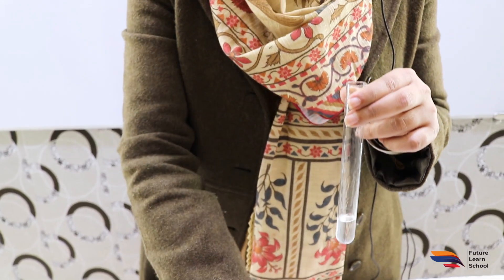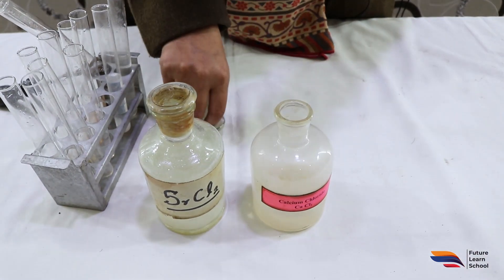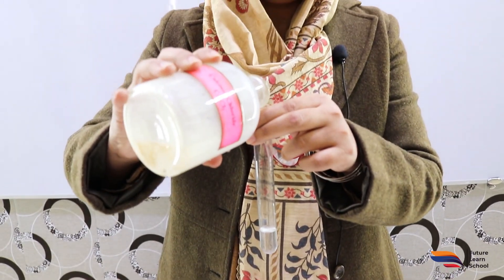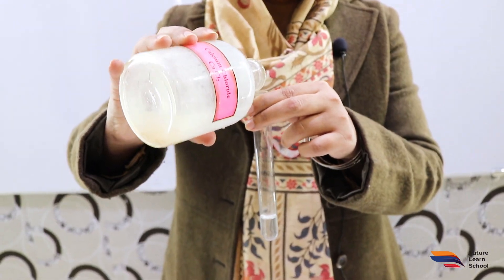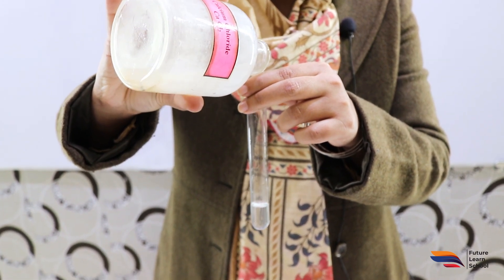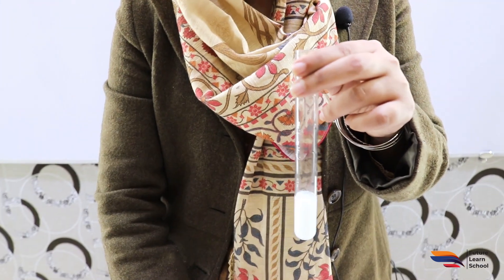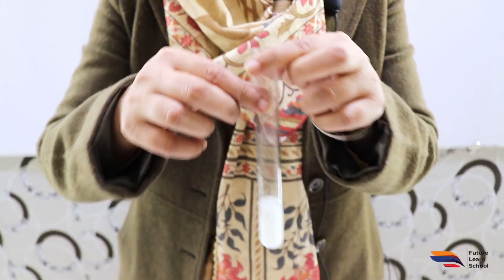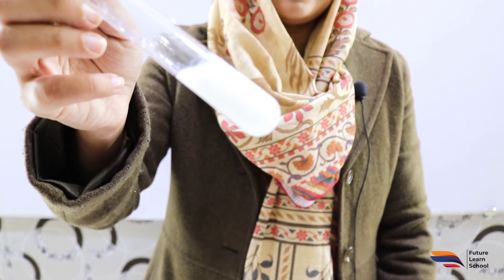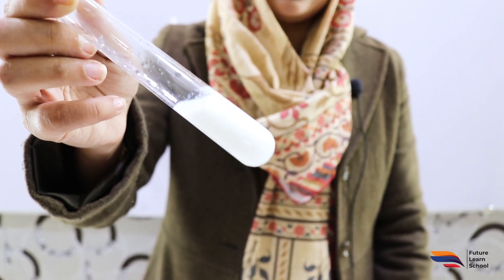The first confirmatory test is the calcium chloride test. We add a small amount of calcium chloride to the original solution and observe the precipitates. We can see that a white color precipitate has formed. This white precipitate clearly indicates and confirms the presence of the carbonate radical.